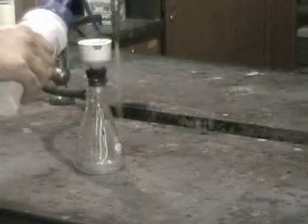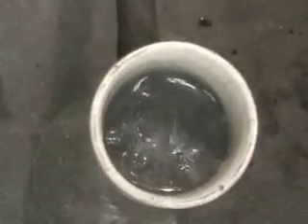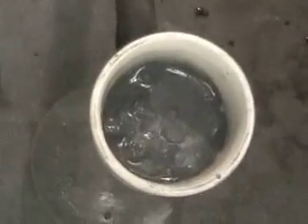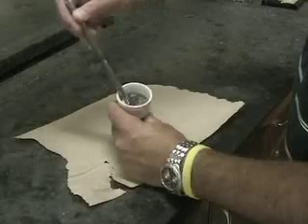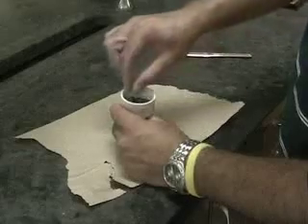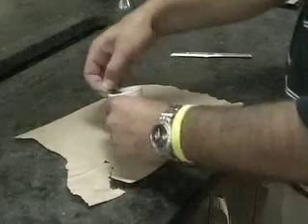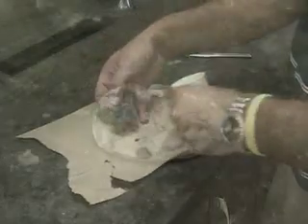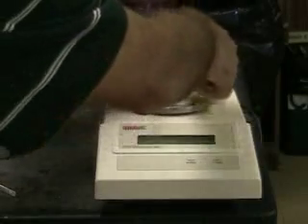As a final step, we wash the silicon carbide to ensure that all the soluble potassium nitrate and copper sulfate is dissolved and washed into the filtrate. In order to speed the drying, we allow the vacuum to pull air through the solid. We then put the filter paper and the collected solid on the lab bench to complete the drying before quantifying the amount of solid collected. We weigh the solid after it is dry.